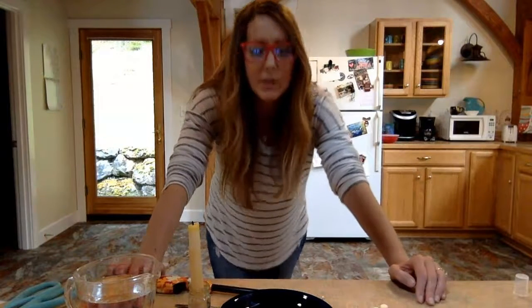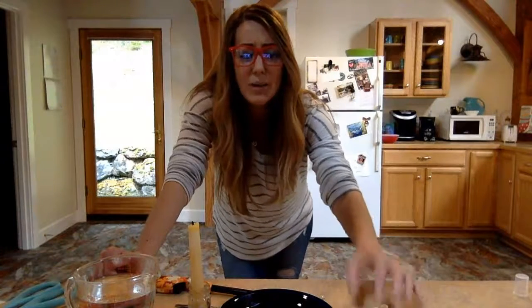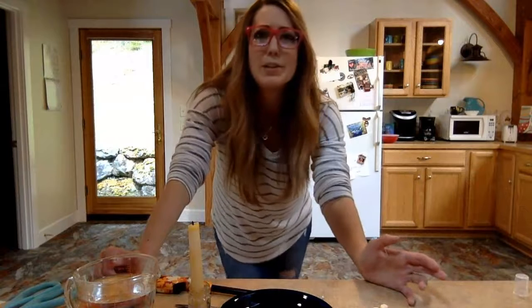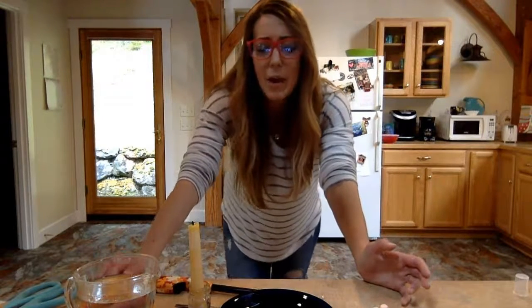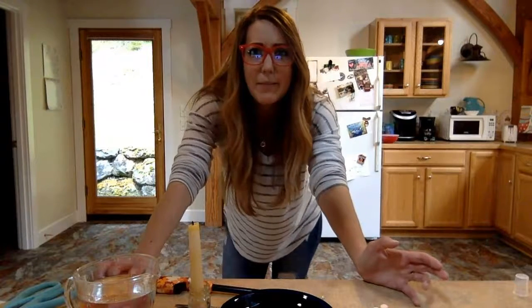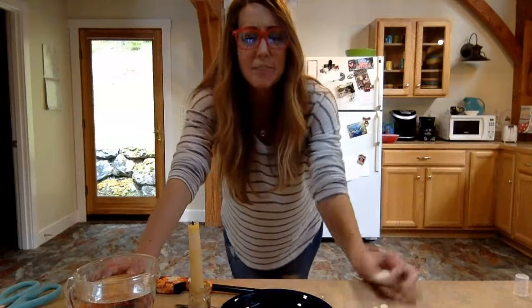So what we're going to be doing is we're going to make some predictions here. We're going to make predictions of how long we think each of these is going to burn. All right, so how long is each one going to burn? Which one's going to burn the longest? Okay, so 8th grade, you remember setting peanuts on fire with me last year, so you've got a little bit of an unfair advantage. But these other items, I want you to make predictions, okay?